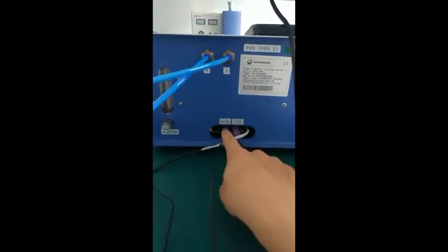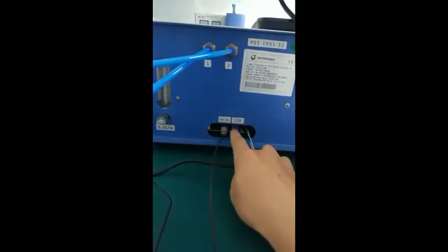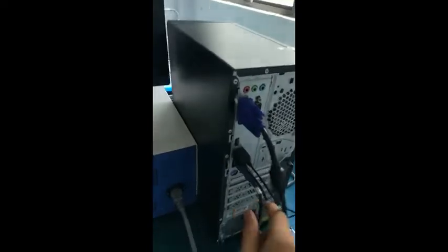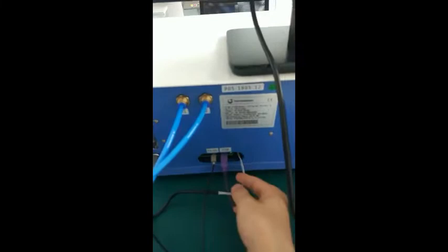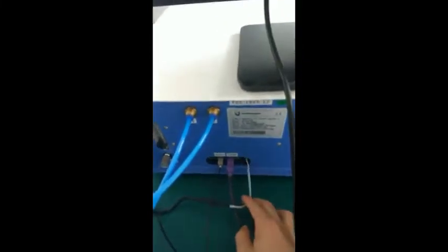Then the optical fiber cable can be connected to the corresponding optical fiber interface of the analyzer, and the USB cable on the side of the analyzer is connected to the computer host.